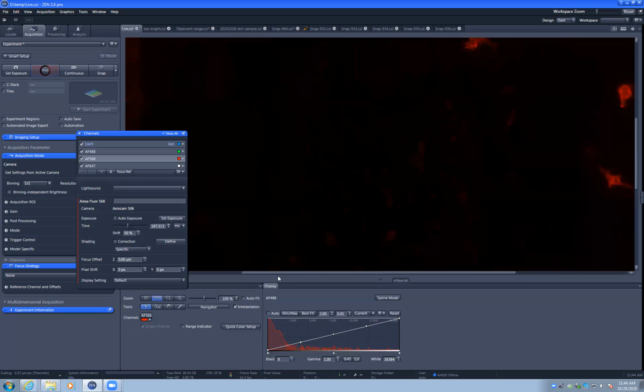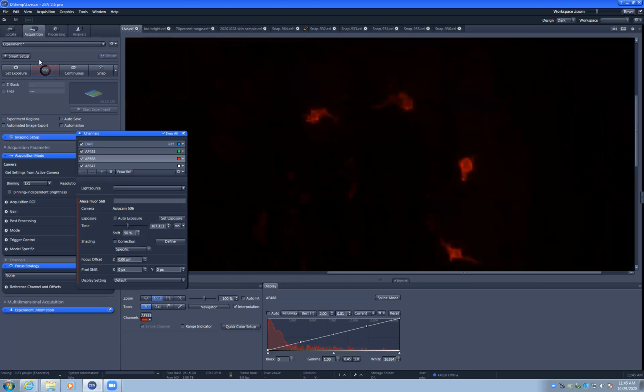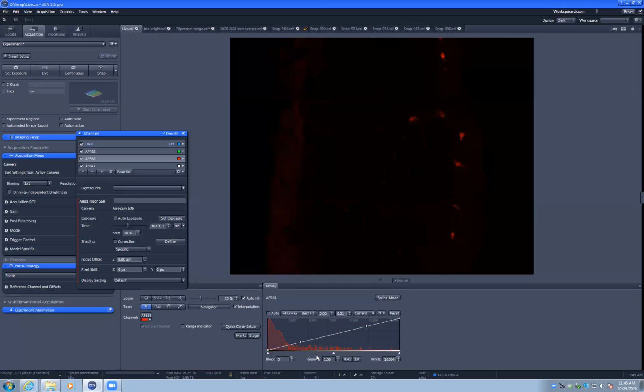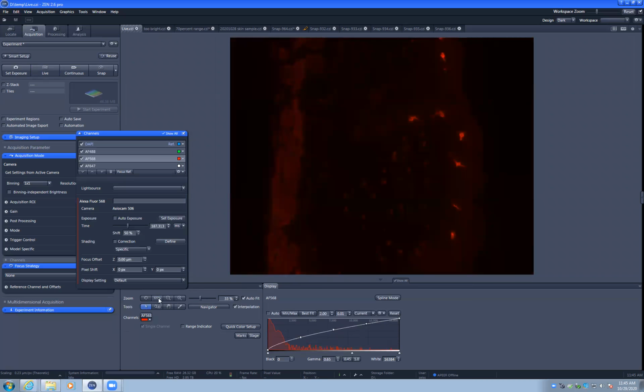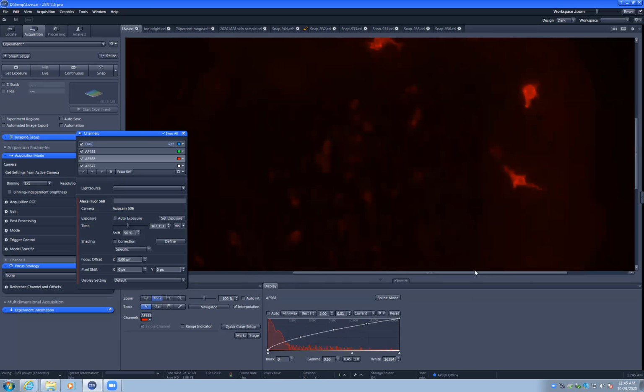So during the talk, I zoomed in, I moved around, I left it in live. What I really should have done is either hit live to get a picture and immediately turn it off, and then I could have done things like adjusting the contrast or zooming up and moving around. Or what a lot of people like to do is turn off the other channels and hit the snap.